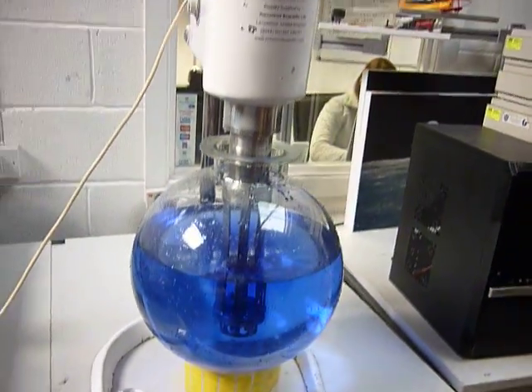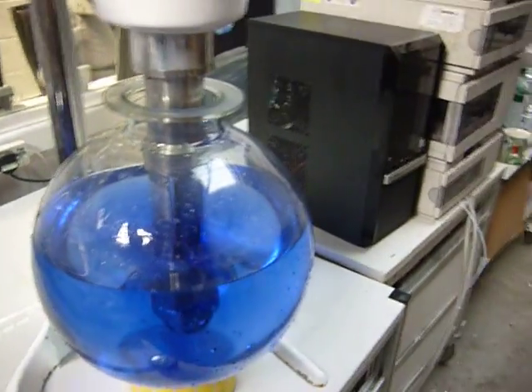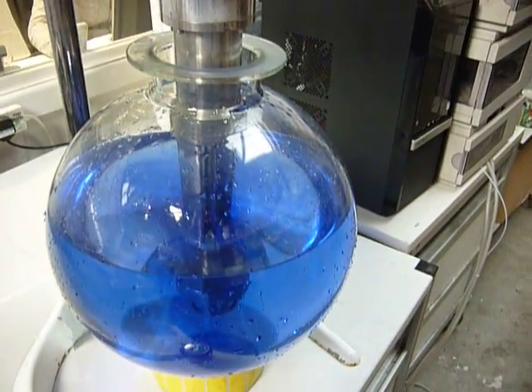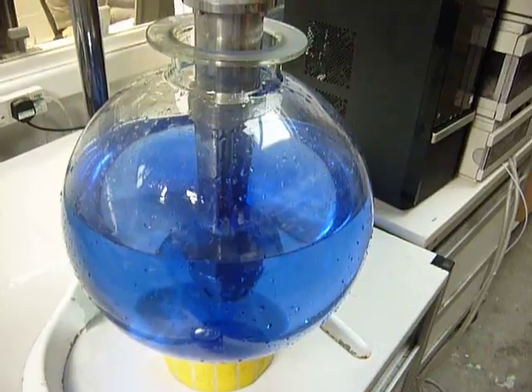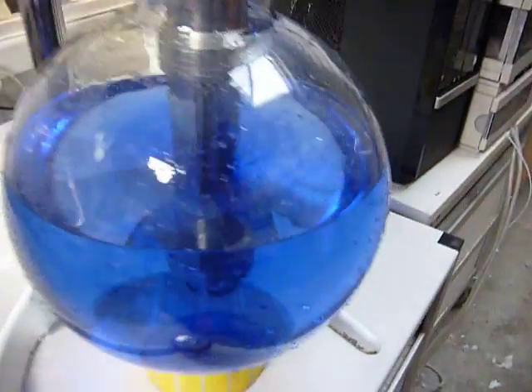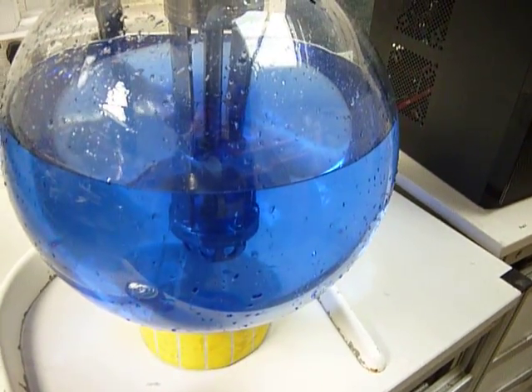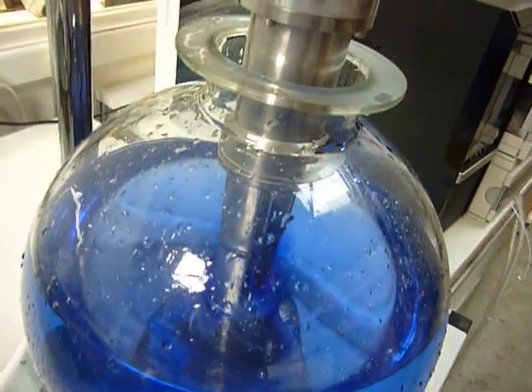So what we're going to do now is just switch the machine on and we'll watch the action as we switch it on. You can see here the switch is just being turned, just zoom in here, start to increase the speed here.